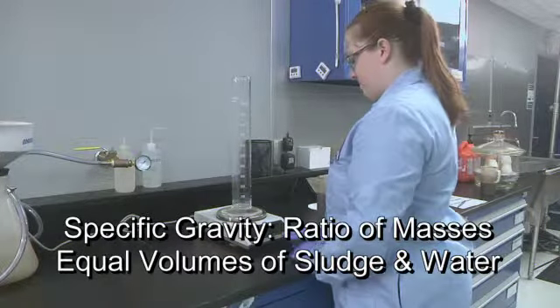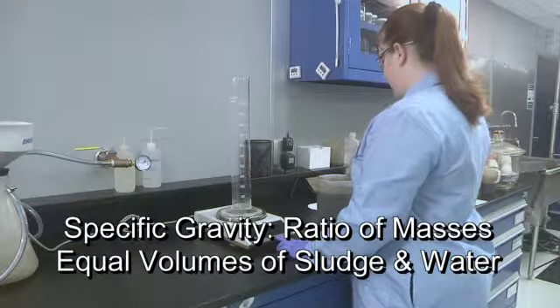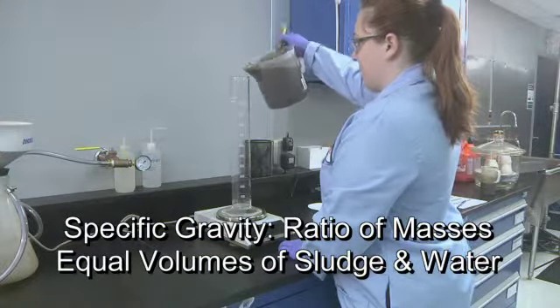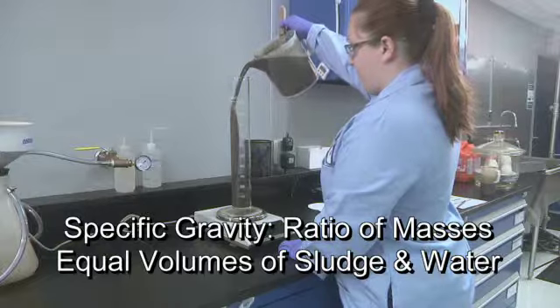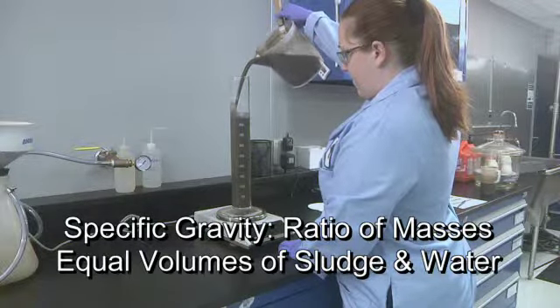The specific gravity of a sludge sample is determined by comparing the mass of a known volume of homogeneous sludge sample at a specific temperature to the mass of the same volume of distilled water.